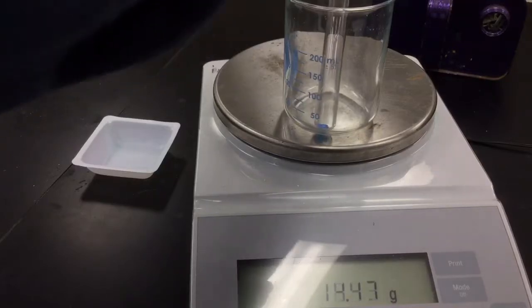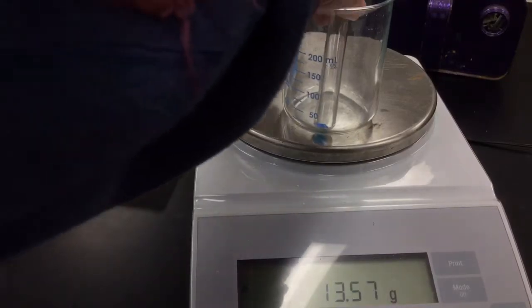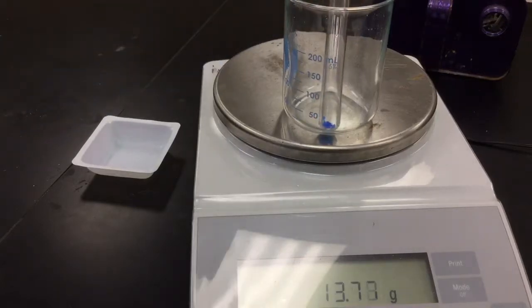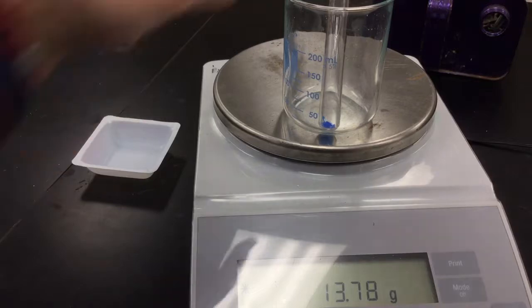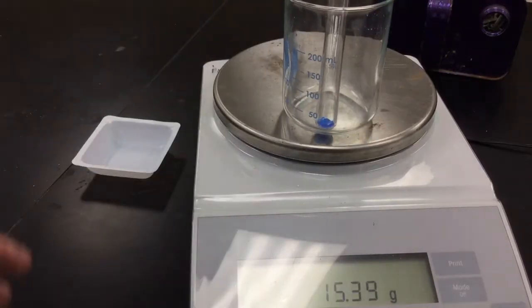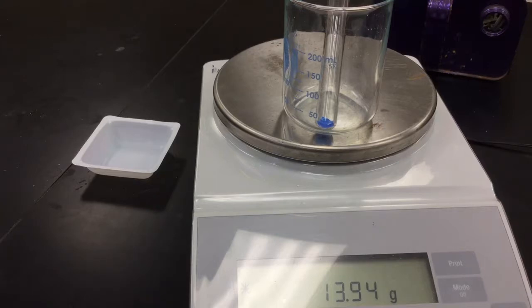Half a gram isn't too much. Let's see if that did it. A little bit more. And I'll add maybe a little bit more in here until we get it. Okay, so my 13.95, and that is my mass of my test tube plus my copper sulfate pentahydrate.